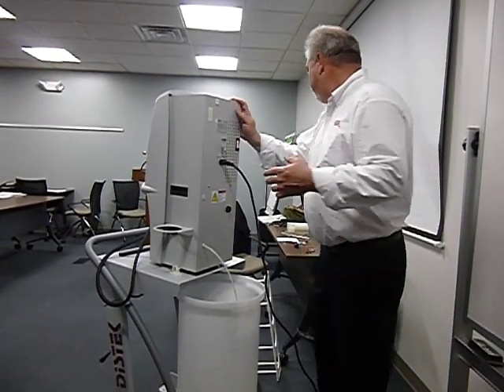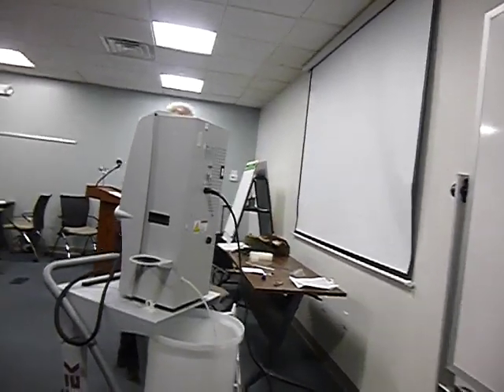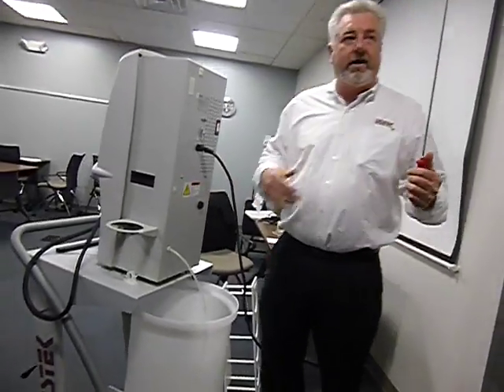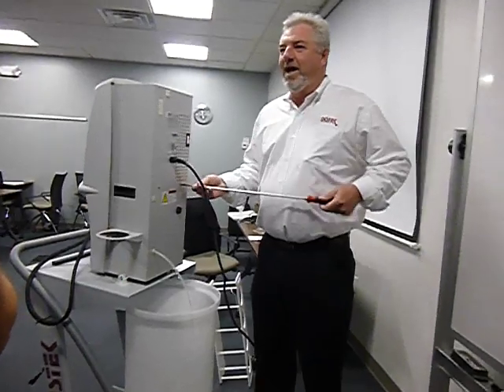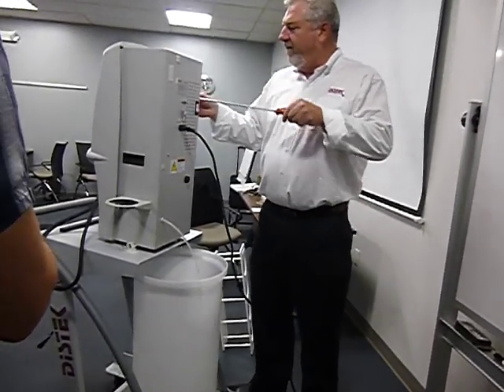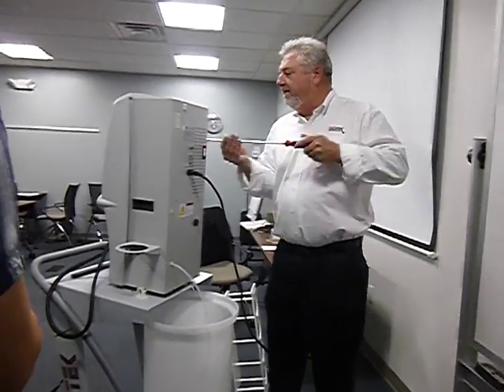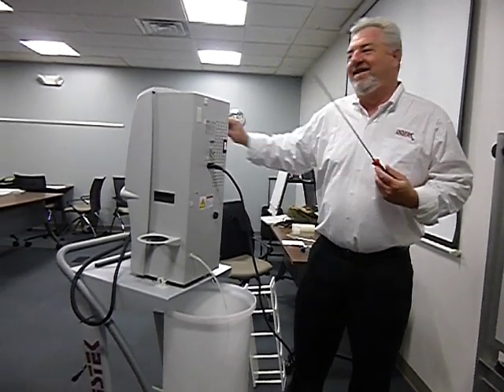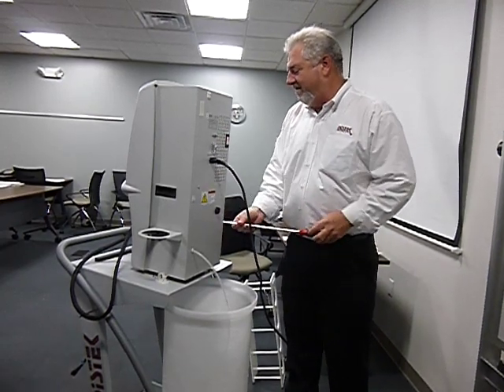Let me get a screwdriver here. Let me take this apart, so everybody knows how the back cover comes off. I usually get a long screwdriver, a really long one, this way for right over here. I can take these screws out real quick. You just don't want to bring this on an airplane.